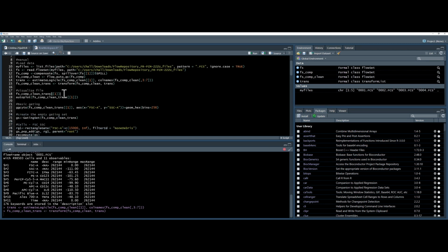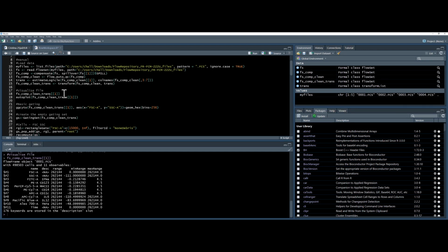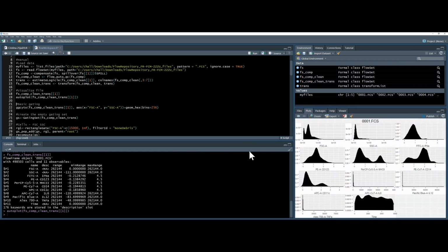Next, I'll visualize the transformed file, to make sure that it looks acceptable, using the autoplot command from ggcyto. It should appear over here on the right. You can see this looks fairly acceptable. Looks like a typical plot. I can see CD14 here, MHC class 2 expression. This looks alright.